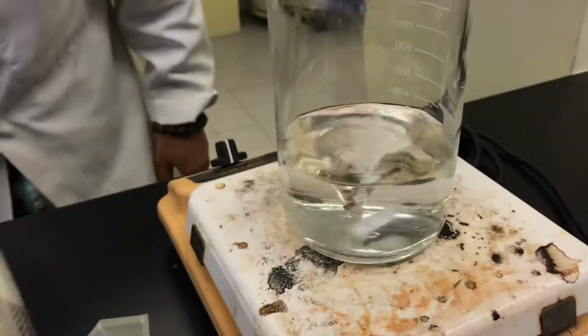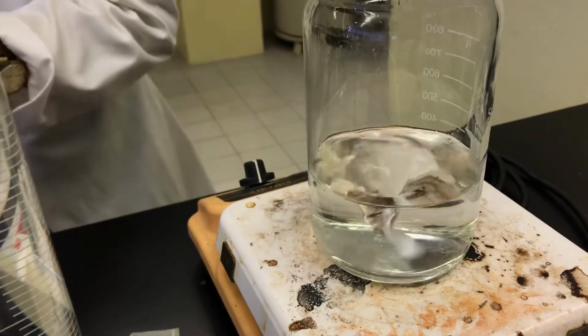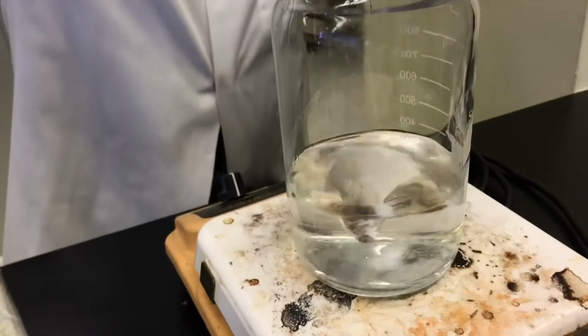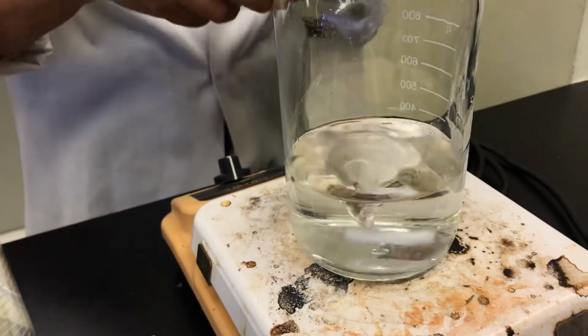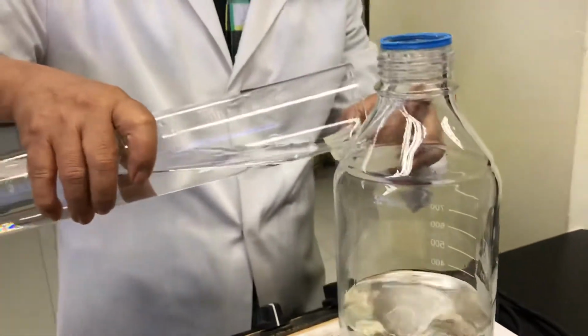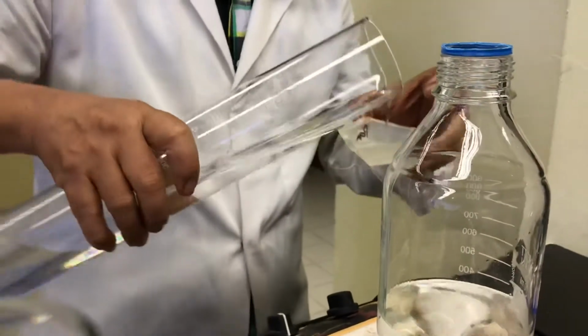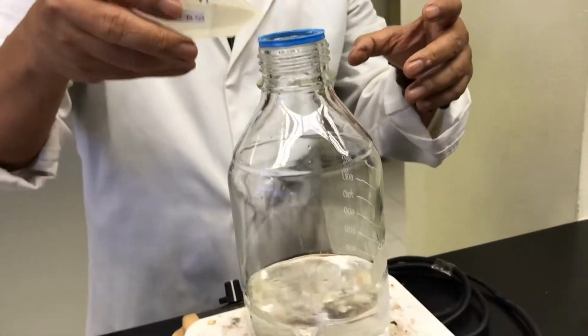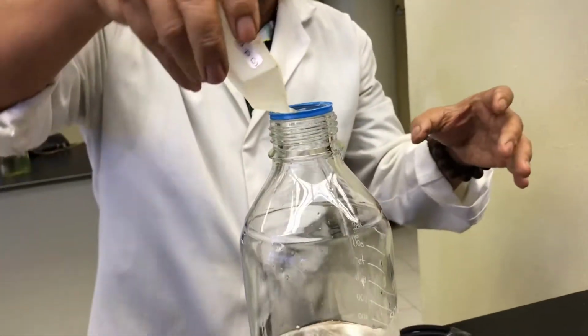Okay, same thing. And then you rinse. You swirl a bit and then you rinse.